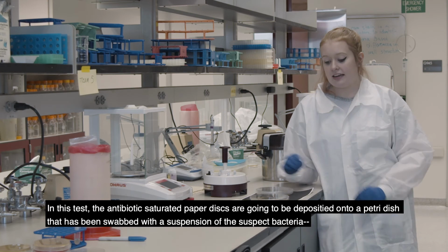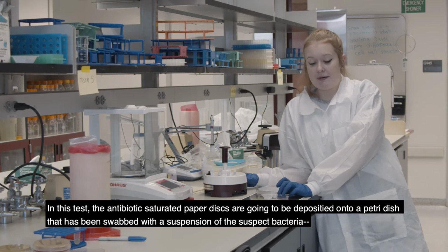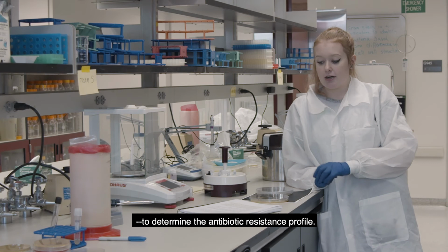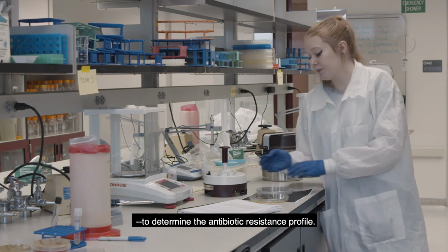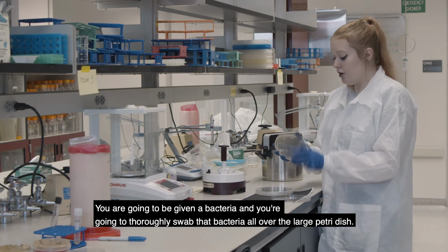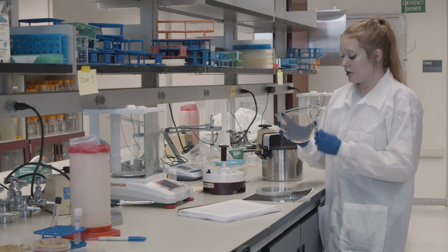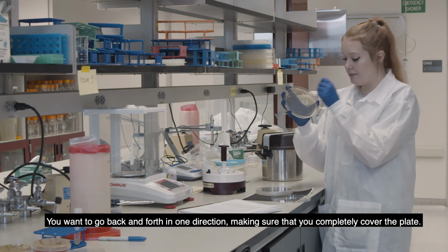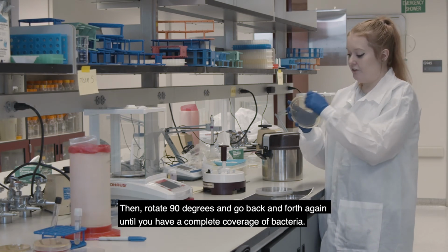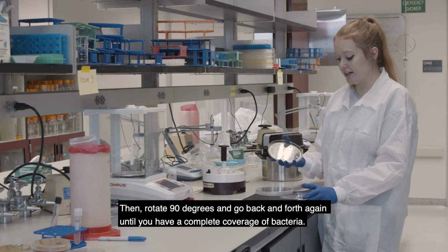And in this test, the antibiotic saturated paper discs are going to be deposited onto a petri dish that has been swabbed with a suspension of the suspect bacteria to determine the antibiotic resistance profile. So you're going to be given a bacteria and you're going to thoroughly swab that bacteria all over the large petri dish. So you just want to go back and forth in one direction, making sure to completely cover the plate, then rotate 90 degrees and go back and forth again until you have a complete coverage of bacteria.